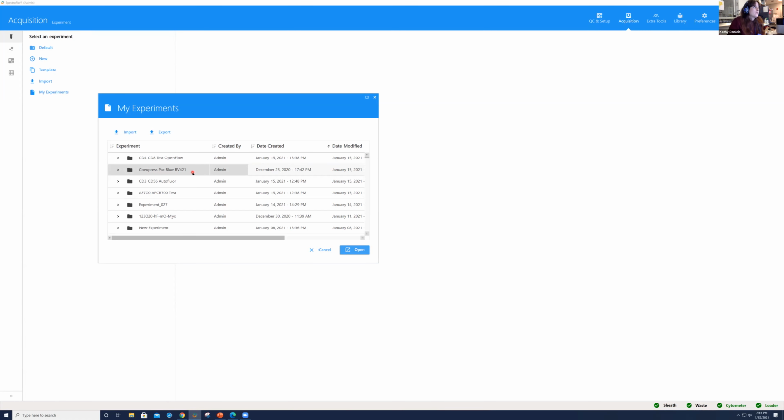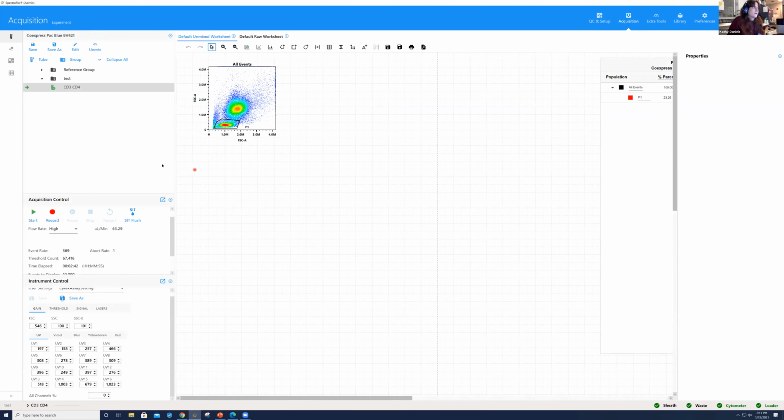markers, okay? So if I double click on this experiment, you'll see that we already have data associated here. And we wanted to show an example, not just of CD4, CD8, right? We wanted to show an example where we would have CD3 and CD4, right? Because you'd expect there to be CD4, CD3 double positive. And can it resolve as well, right? These two fluorochromes are very similar. So what do we expect here?